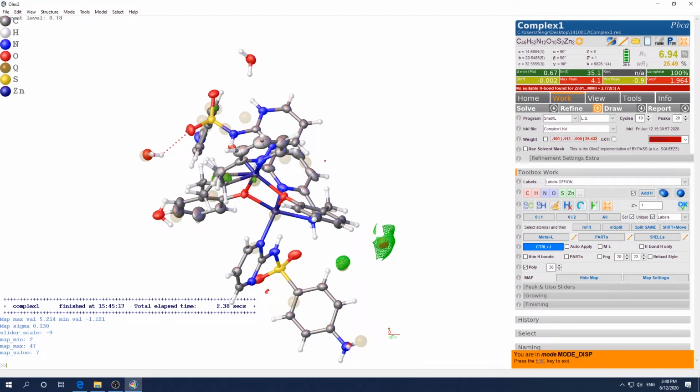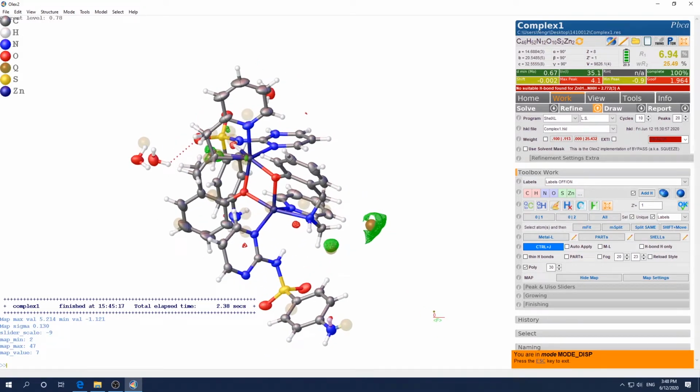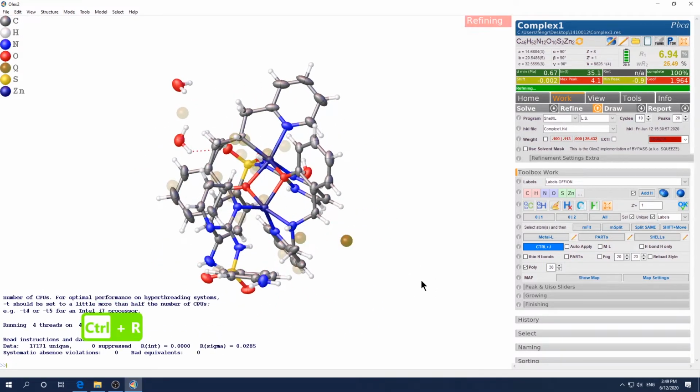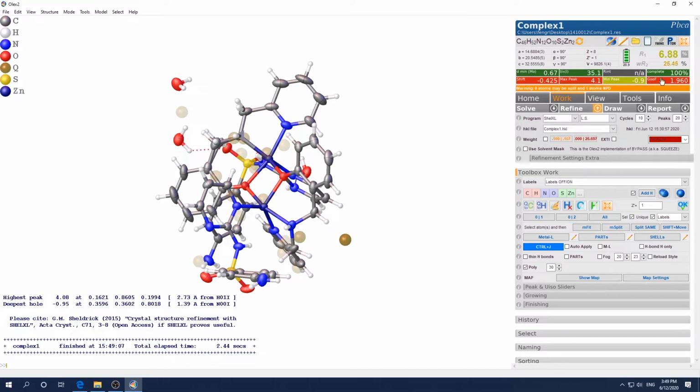I mean, it looks finicky the first time, but if you practice many times, your hand can move much faster than your mind or your mouse. Okay, so then press escape to exit this mode. Then let's just refine again. Let's see, 6.94. See what it will change to. Okay, see, that means we are in the right direction.